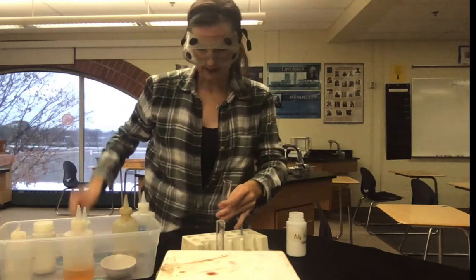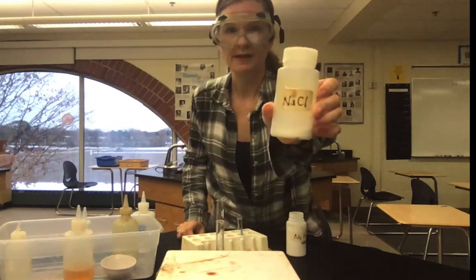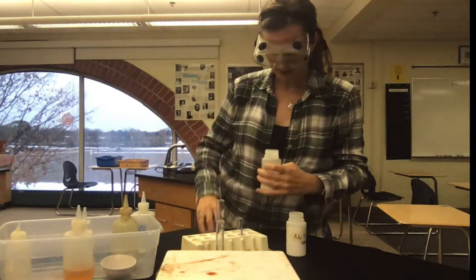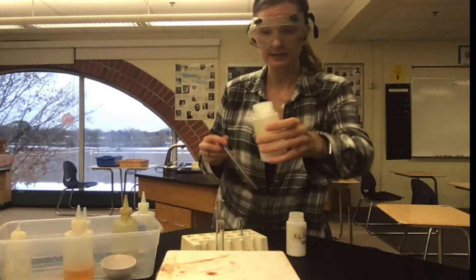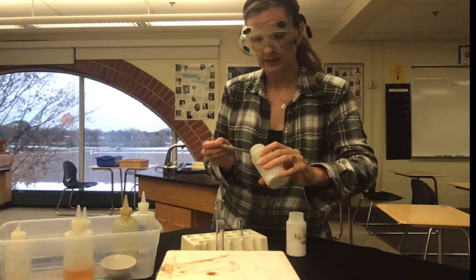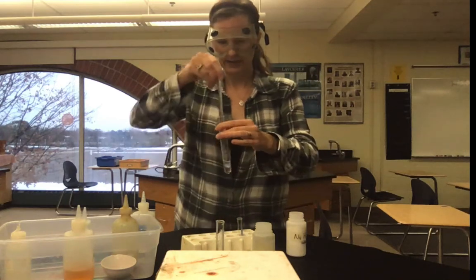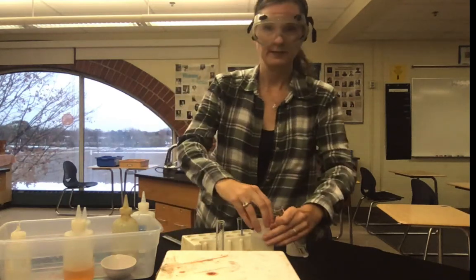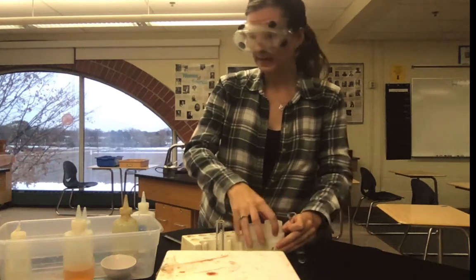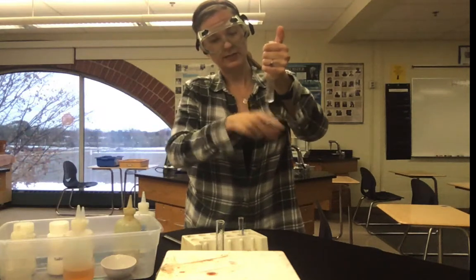And then the other thing I'm doing is adding a very small amount of this sodium chloride. Sodium chloride is table salt, in relation to you gathering data of what the compounds look like. I'm just going to take table salt, place it into my test tube. And then I'm going to mix them up so that we can see what happens to the two substances once they're together.